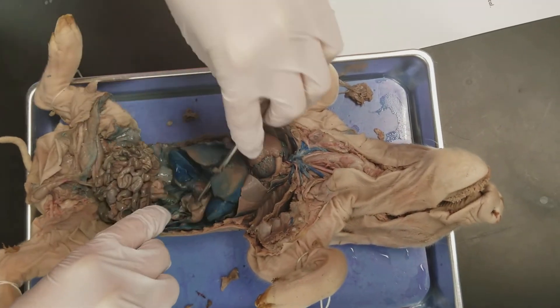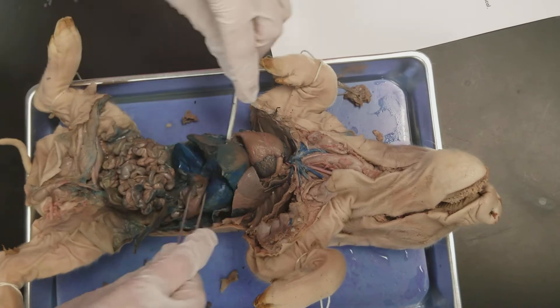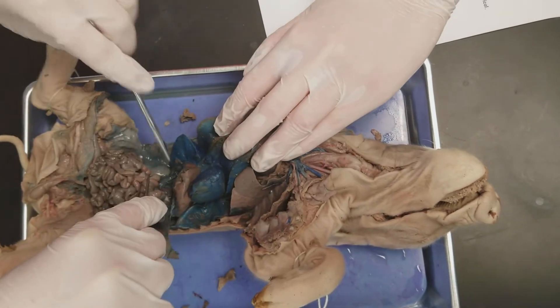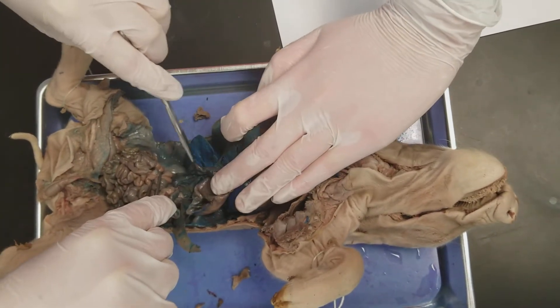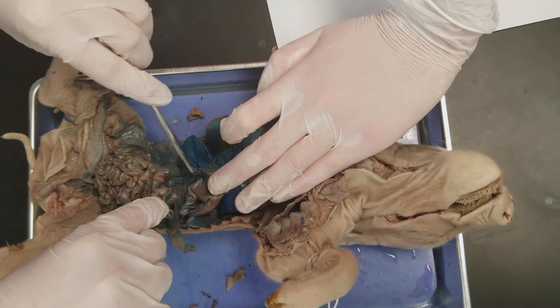The duodenum is this part here. We weren't able to completely find the common bile duct, but it's on this part.